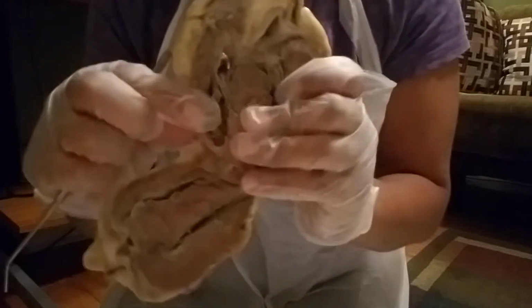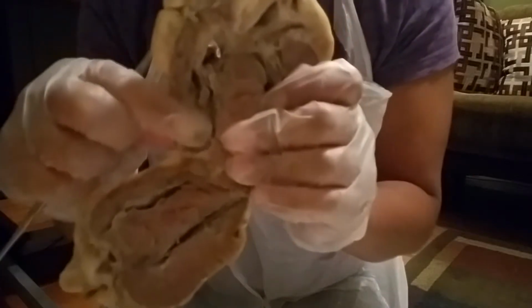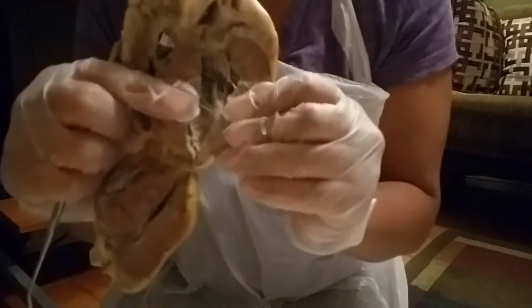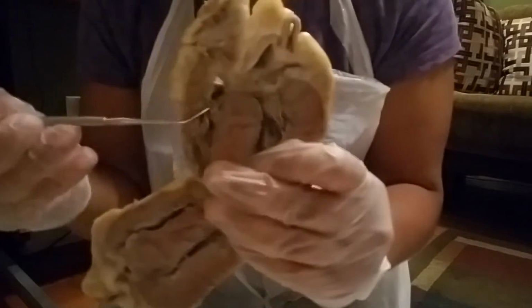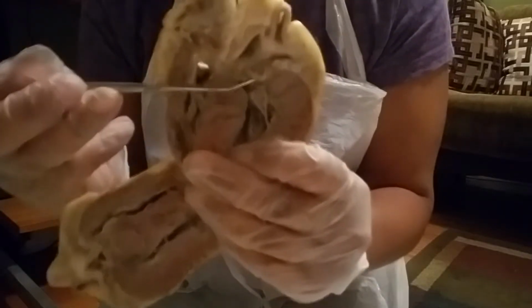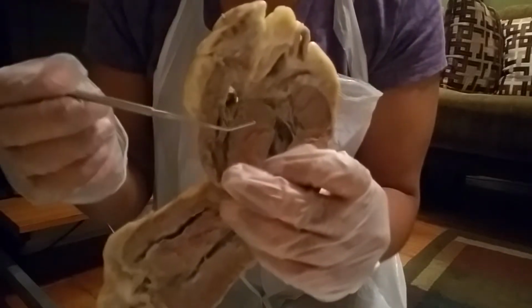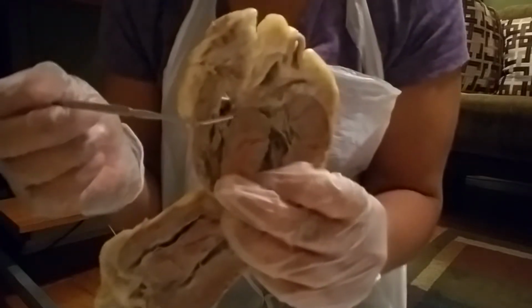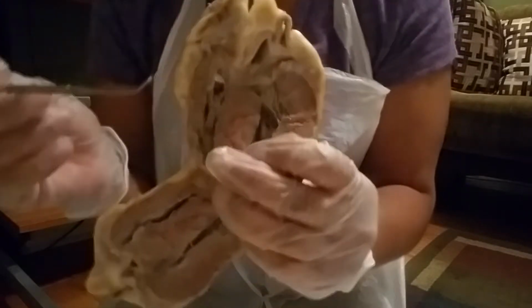And inside, the inside layer of the right ventricle area is known as the endocardium, also in the left ventricle area. The right atrium area, the left atrium area. A helpful thing to remember is that atriums are on the top and ventricles are on the bottom. I remember that because there's a saying that goes A before V, like in the alphabet.